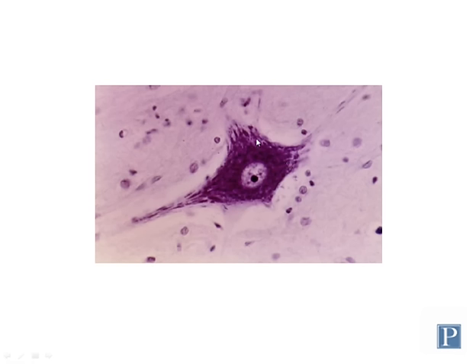These represent polyribosomes, and they are found mostly in the cytoplasm of the cell body of the neuron, right here. You can also find them in the proximal portions of dendrites, but not in the distal portions of dendrites. With a Nissl Stain section, you can actually distinguish between dendrites and axons, because the dendrites do contain Nissl bodies.